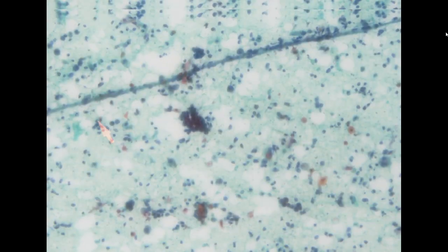Are they squamous? Are they glandular? These appear to be most likely squamous cells. We see a lot of high NC ratio dark nuclei along with superficial cells with a weird-looking spindle shape. So this is consistent with squamous cell carcinoma. It is not so common to see, but just this week we have two cases. Sometimes they come in one week and then you wait two months with no positive specimen, but this is a squamous cell carcinoma case. Again, the patient was never screened, so screening is very important.